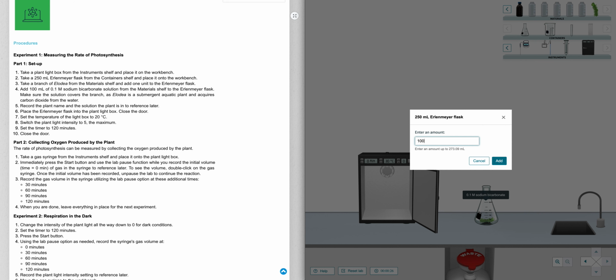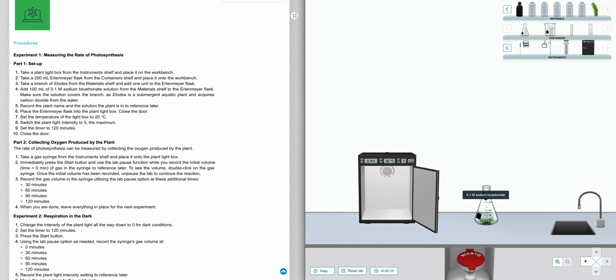So we're going to type 100 milliliters and add that. You can see it increasing right here. At this point, step 5 says to record your plant name. So Elodea is that, and the solution is sodium bicarbonate, so you can use that for later. And then in step 6, it says place this whole thing in the light box.